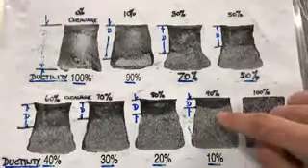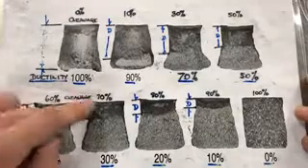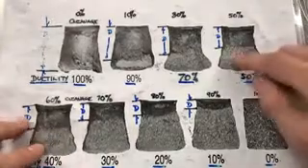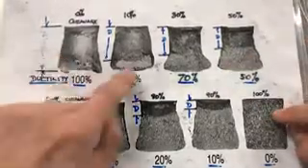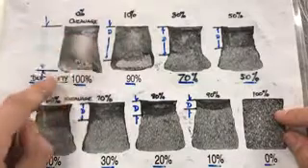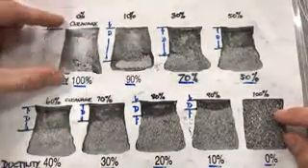You see the surface area that is related to brittle fracture is reduced when we go from right to here to the left, and there's very minimum brittle fracturing appears here, and no, like 0% of cleavage here, so 100% ductility.